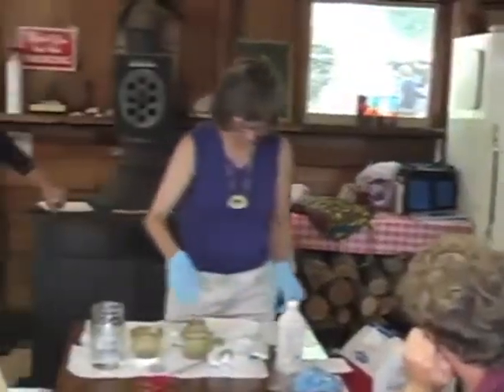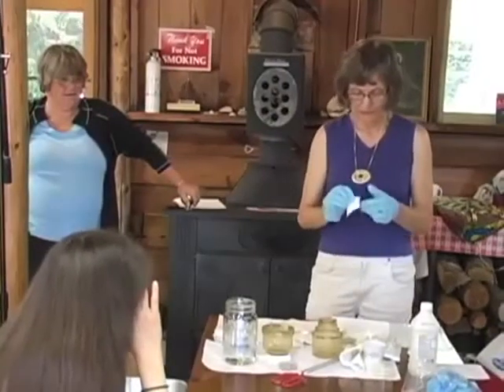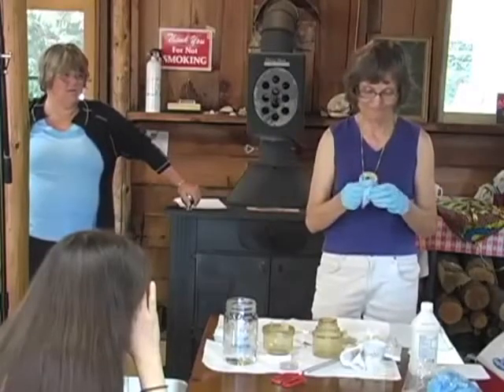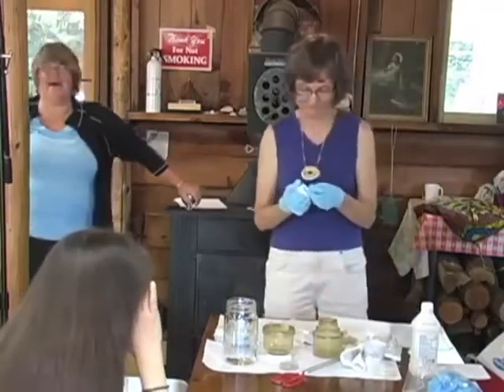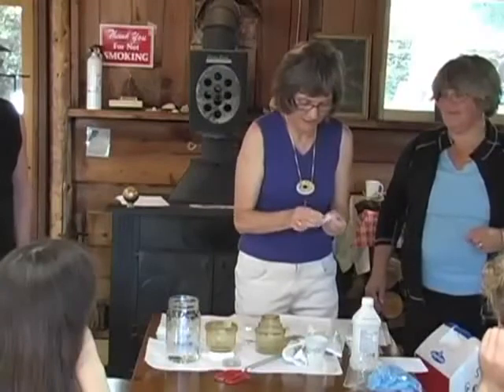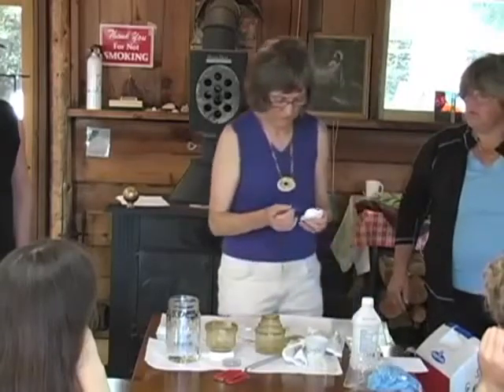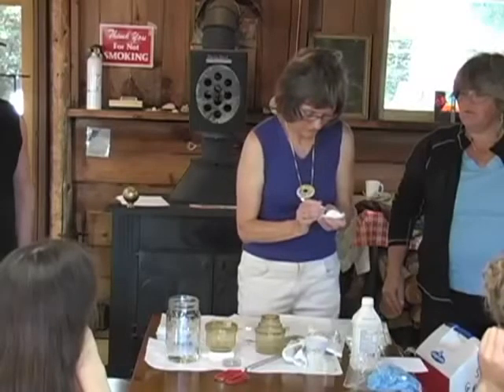Place a sterile filter paper on top of the filtration system's membrane with the sterile forceps and avoid contamination. Do not touch with finger. Now, this is probably the part that I cannot do in these gloves. So it requires some fine motor. We want to peel back. If I'm getting this right, you can touch the blue, you can't touch the white. True? False?